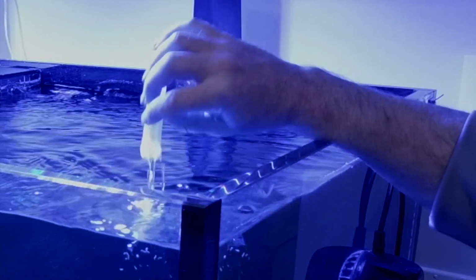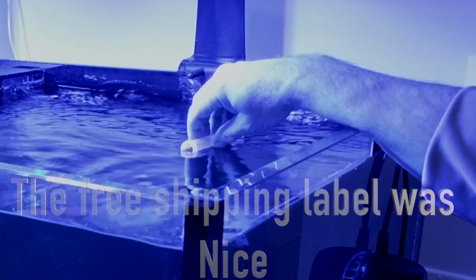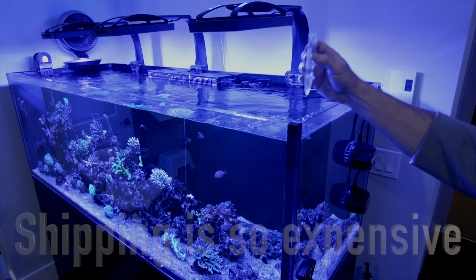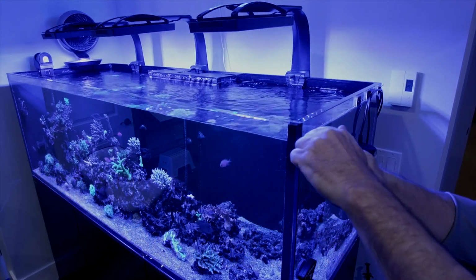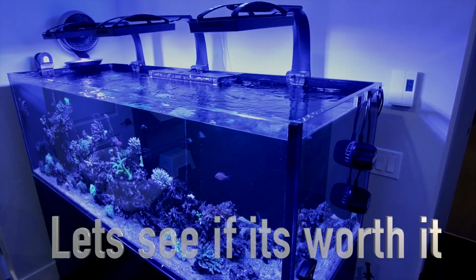We'll get that rinsed out and get our sample. Again, nice high flow area. This is early in the morning, and all the water samples are taken within a couple of minutes of each other. So another one is ready to go. Let's get this off into the mail.